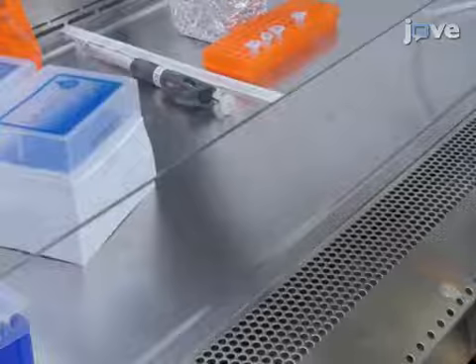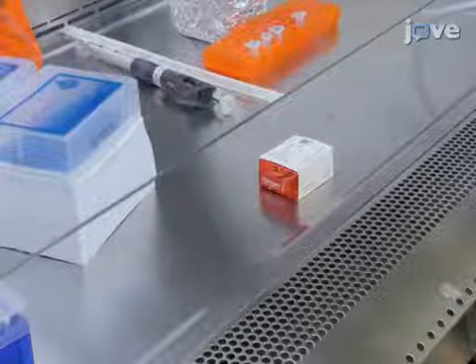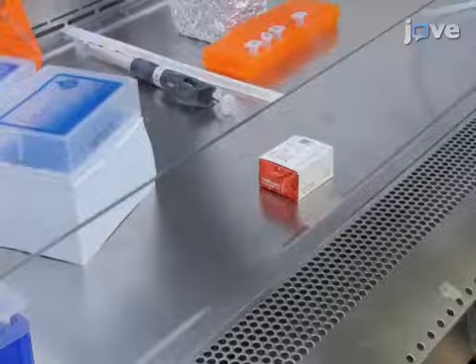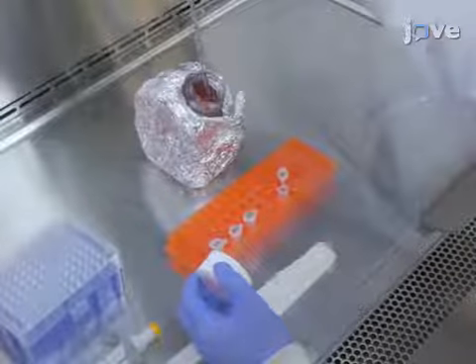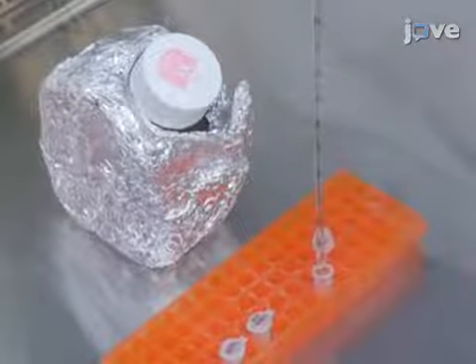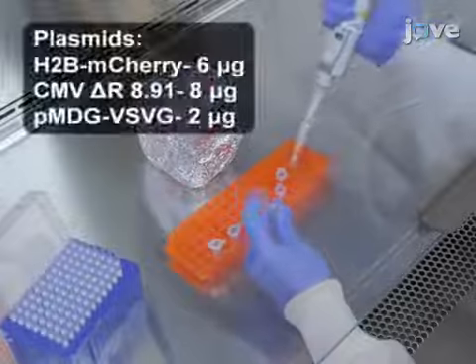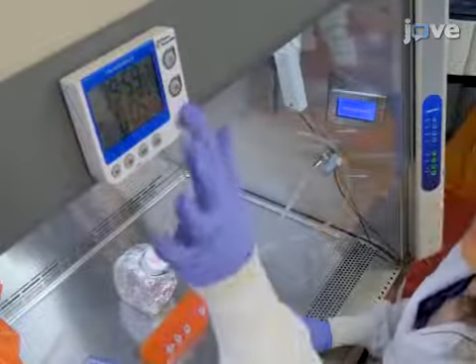The next day, just before starting transfections, remove a vial of the transfection reagent from 4 degrees Celsius and leave it out to reach room temperature. Then, to start, add 1 milliliter of reduced serum medium to a sterile microfuge tube. To this, add specified amounts of lentiviral vector plasmids used for transfection and mix by pipetting. Incubate the tube at room temperature for 5 minutes.